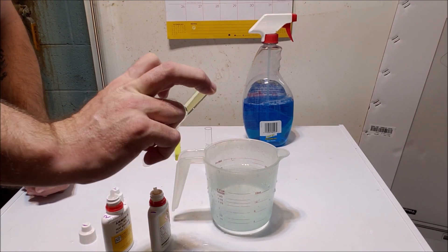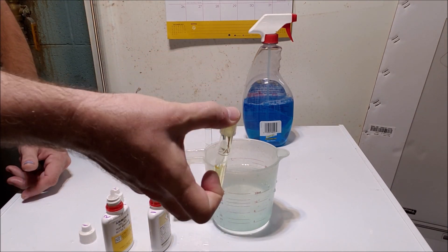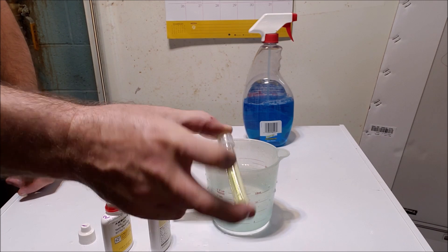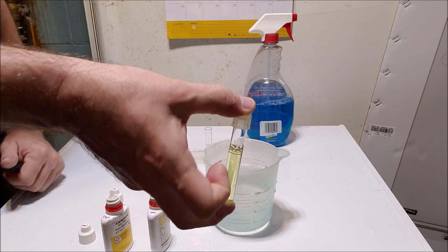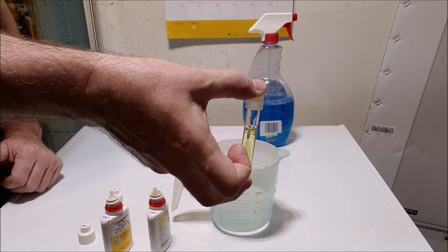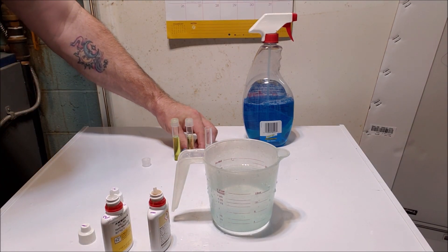I find that when I shake these little bottles, they tend to leak and you get splatter coming out from around the lid. If you just rock them back and forth like this, you still get a good thorough mixing. When you turn it upside down, wait for all the liquid to run this way, then turn it upside down, all the liquid to run that way. And you do that, again, ten, fifteen times and you should be good.